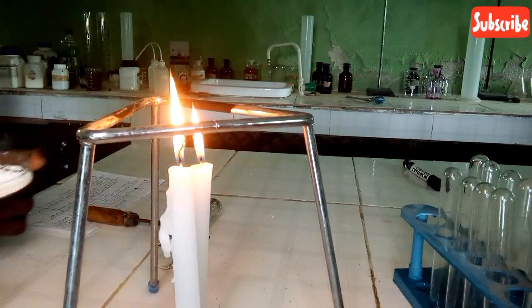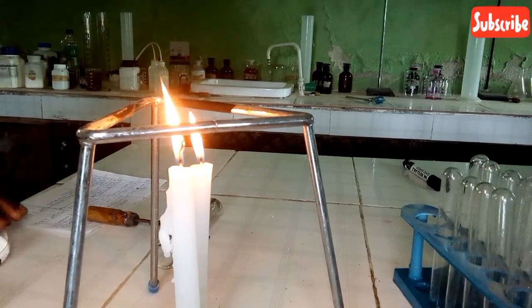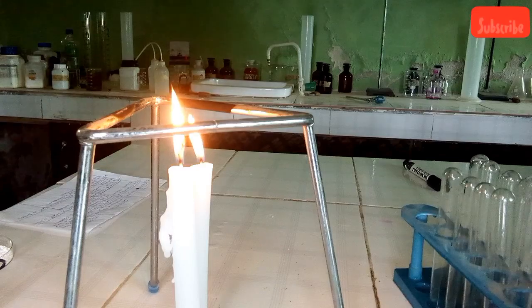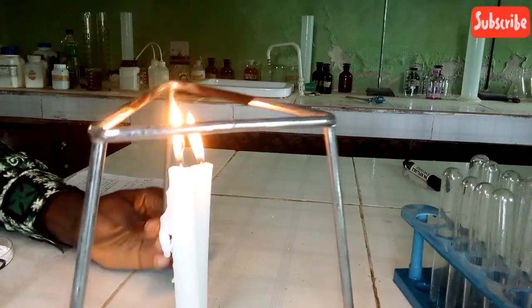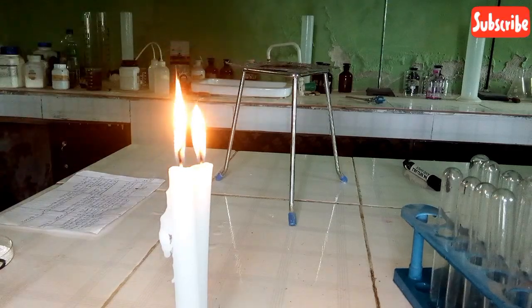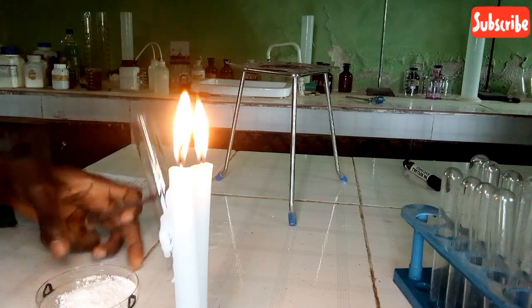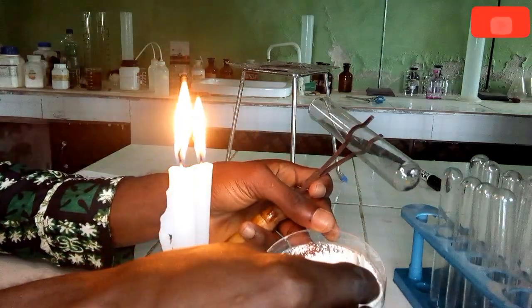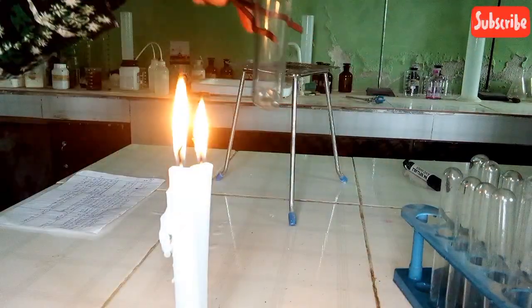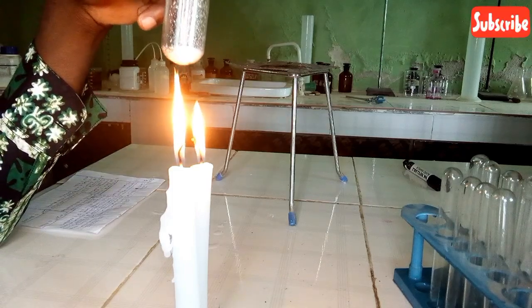We are meant to perform the first test: take a portion of D and heat strongly. So I'm going to take a portion of D undiluted. I'm not going to dilute it with anything, just heat the salt directly, strongly. To heat it strongly, I'm not going to use this; I want to heat it with a direct flame, so it will be very, very strong. So now let's take sample D. I will add it to the boiling tube and then heat. Let's see the response.